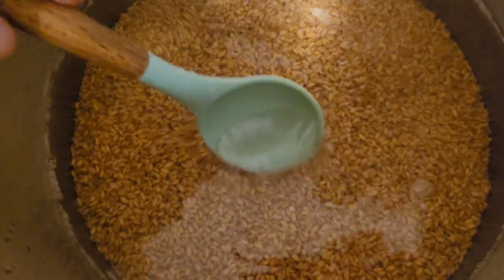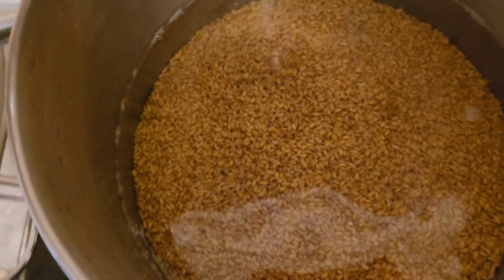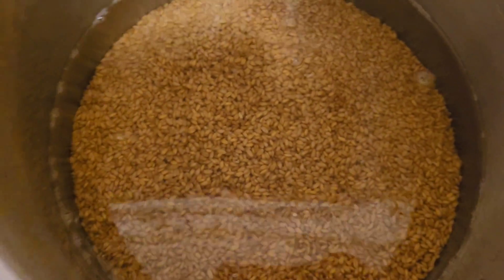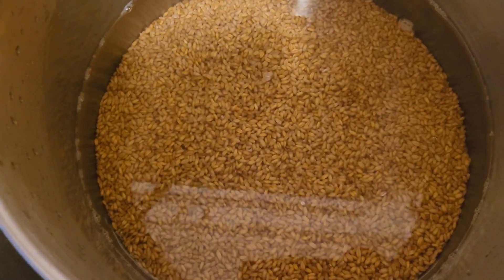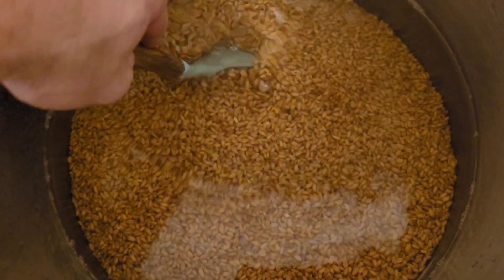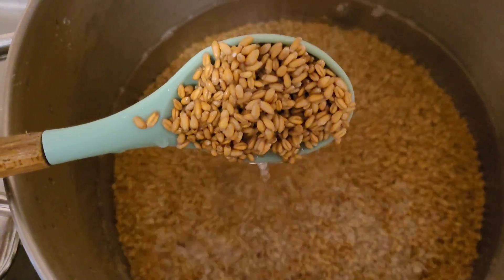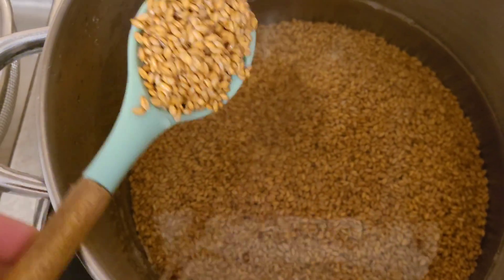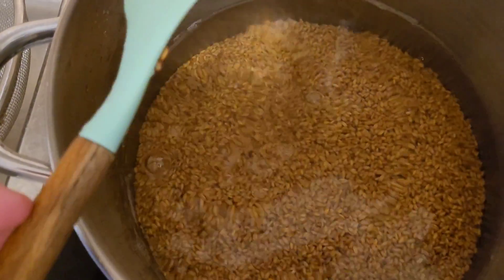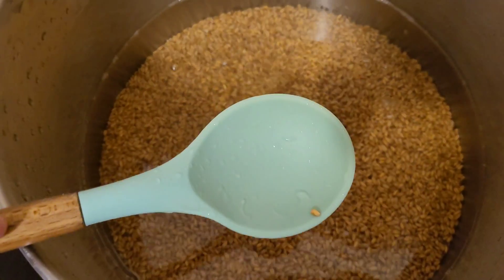There's no more excess bran or bits of debris from your bags. Now you might say, what's the point — all this stuff is just food for the mycelium. Well, maybe to some extent it is, but more importantly your sterilizer works by condensing steam on the surface of your grains to sterilize, and you don't want a whole bunch of overburden inside your jars or bags that your sterilizer is going to have to make contact with.